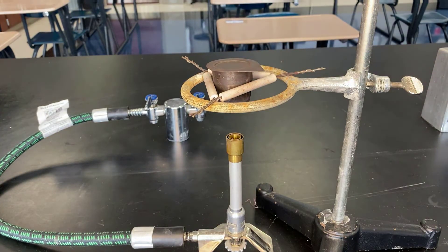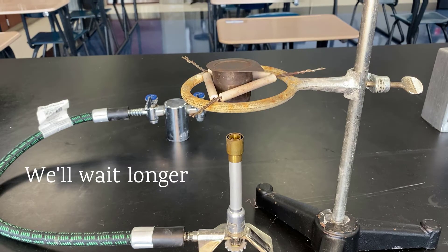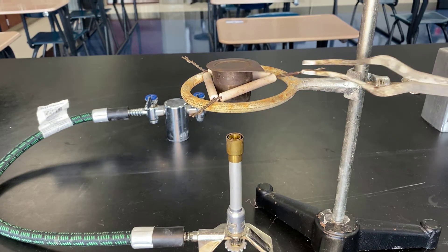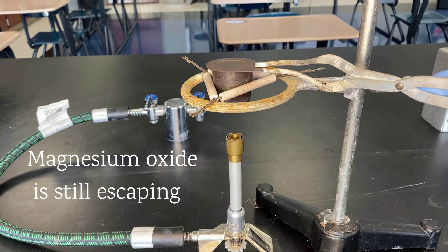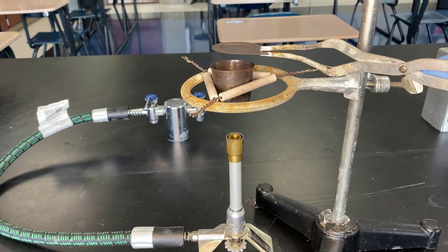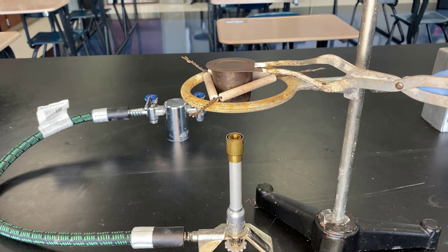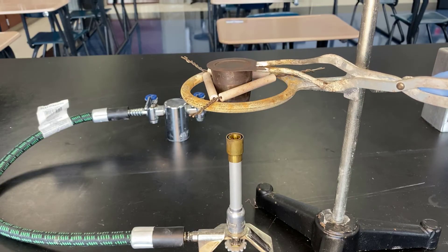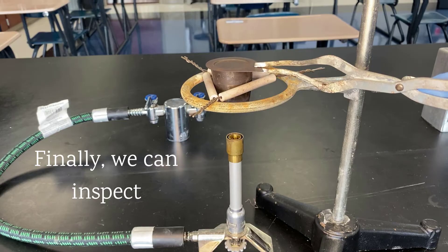It's not like it's going to do a whole lot of good when it's that excited, but I'm hoping that any little particles can sort of be knocked back down to the bottom. I still haven't waited quite long enough. Part of the issue is that we do need oxygen to get into the vessel.